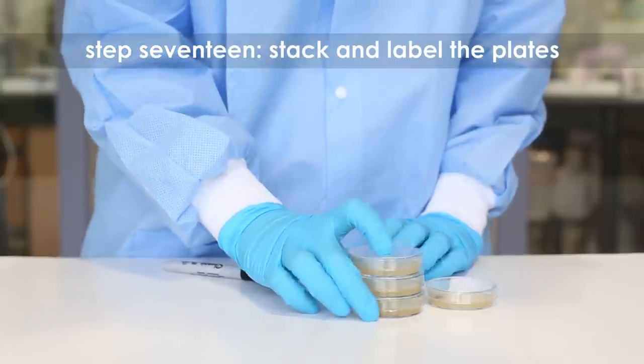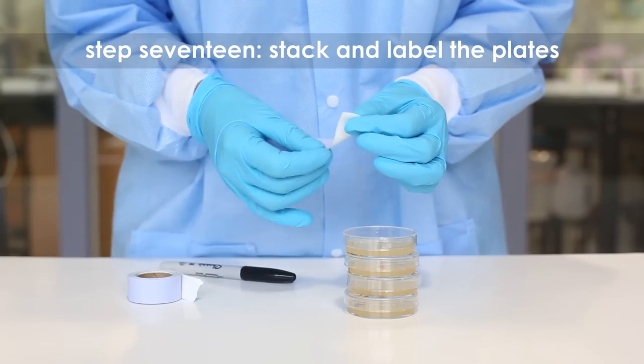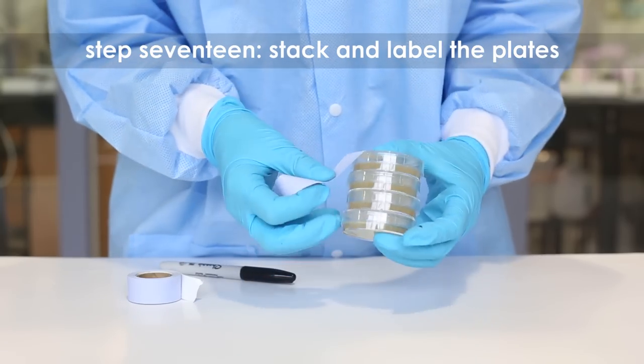Step seventeen: stack the plates on top of one another and tape them together. Label the plates with your initials or group number.